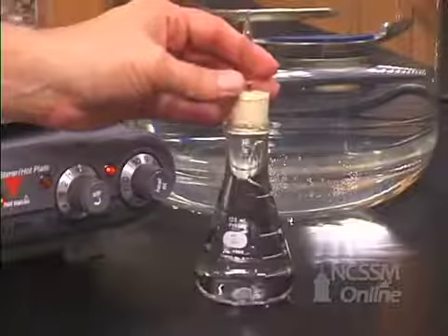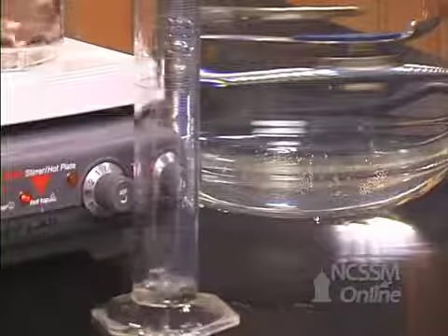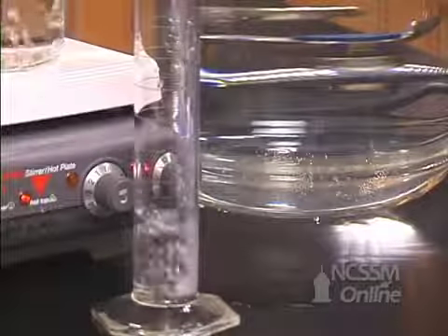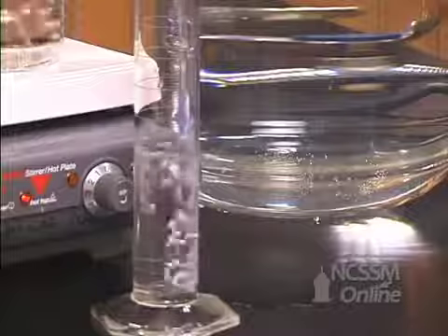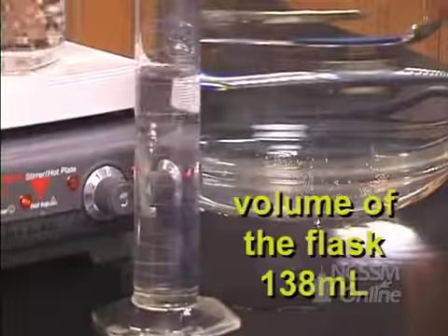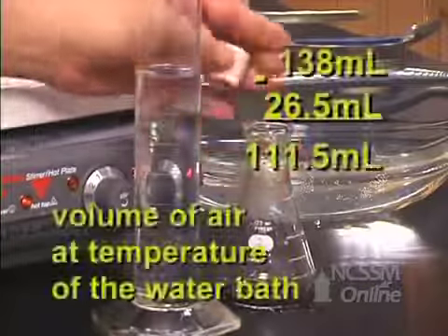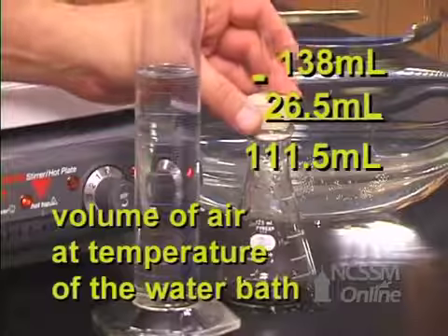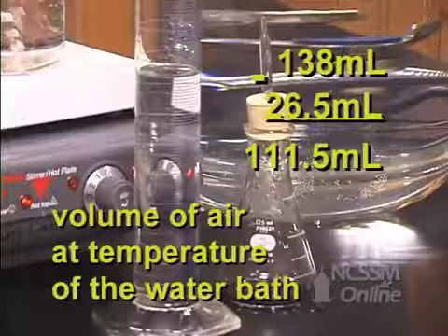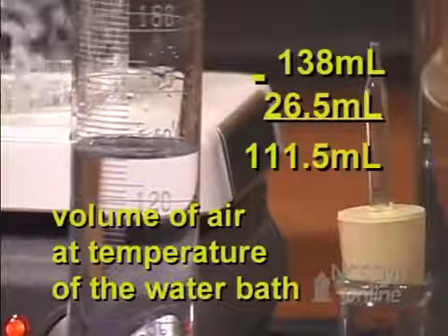We will now measure the volume of the water that is necessary to completely fill the flask. The volume is 138 milliliters. The difference between the volume of water required to completely fill the flask and the water that was in the flask after cooling is the volume of the air at the temperature of the large water bath.